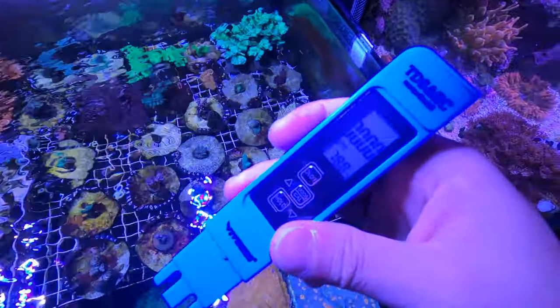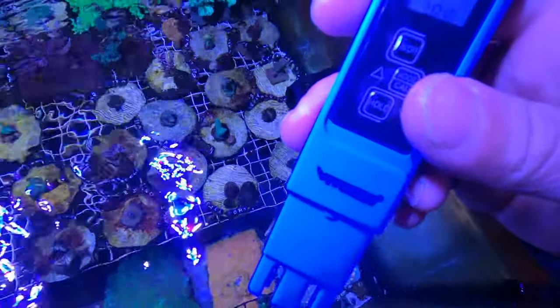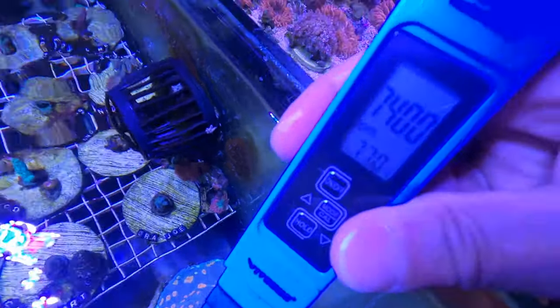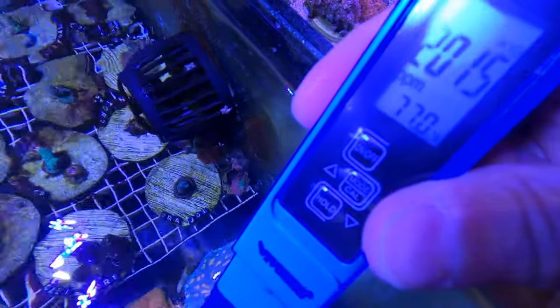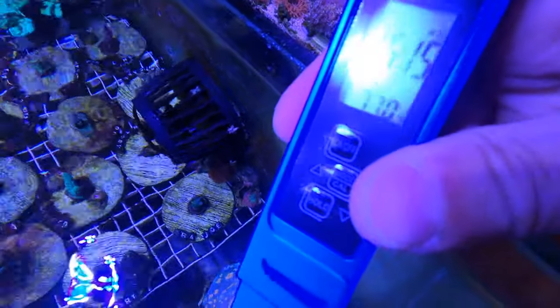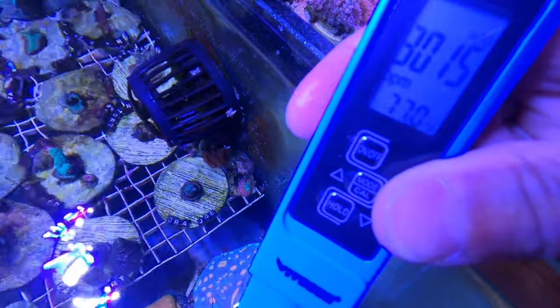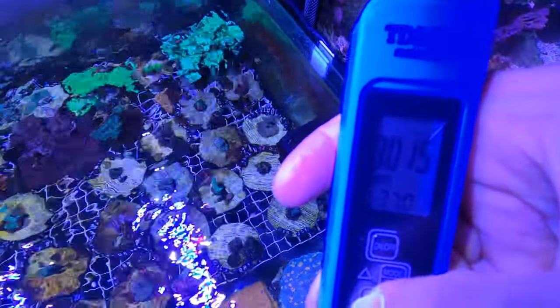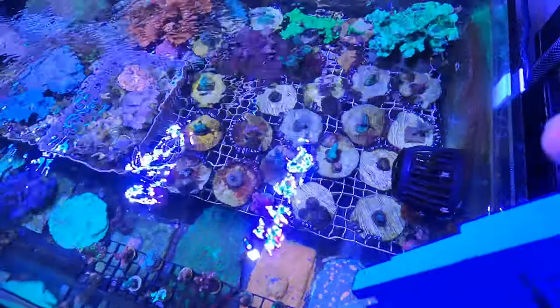Here's the TDS meter. There's a little readout showing temperature at the bottom. I'm going to dip it in. The temperature looks accurate — I did set my heater to 77°F. The TDS is reading anywhere from 3015 to about 3020 ppm. I'll press hold — 3015 is the number. I'm going to go dip it in my RO water and see what that TDS reads.